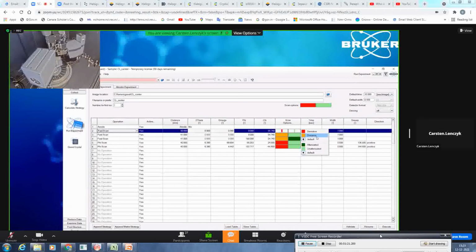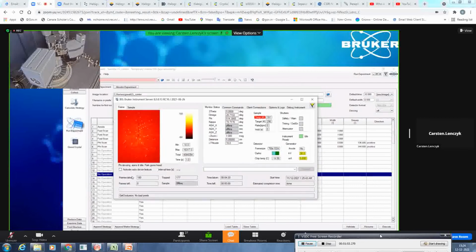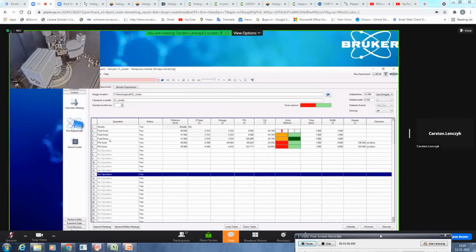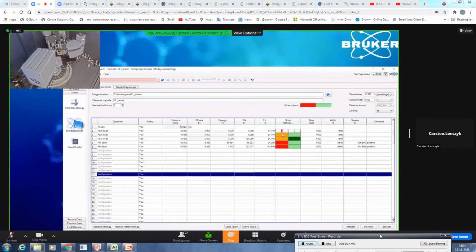If you still get some topped reflections in the dynamic mode, you will have the additional option to attenuate your primary beam. So with that option, the software will trigger an attenuator to be rotated into the primary beam, and will then lower the primary beam intensity a little bit to further allow the recollection of topped reflections. So most of the time, I would emphasize, check closely after your fast scan if any frames have been topped. If not, you don't have to bother to recollect them with dynamic or whatever. If most of them are topped, you can either decrease the exposure time or ensure that you also add a fast scan in a different detector setup.